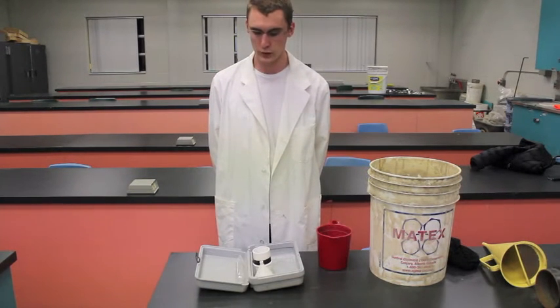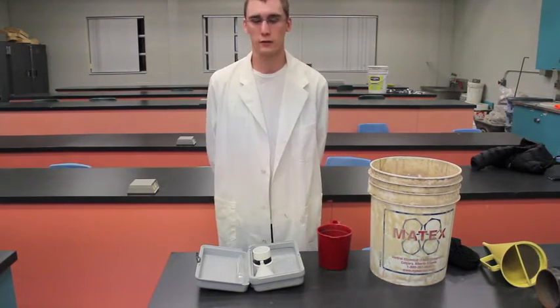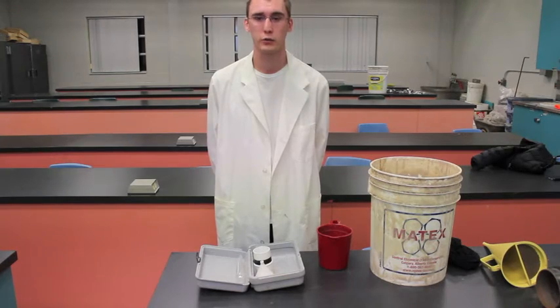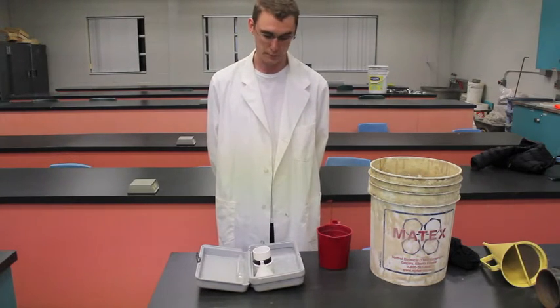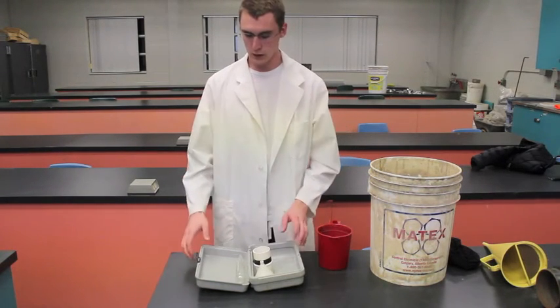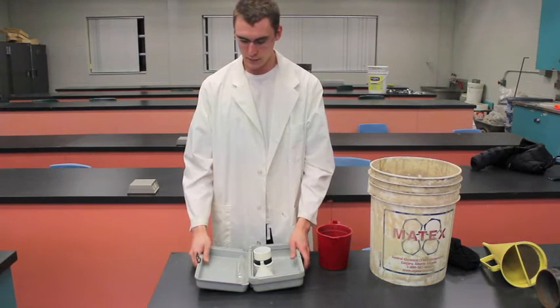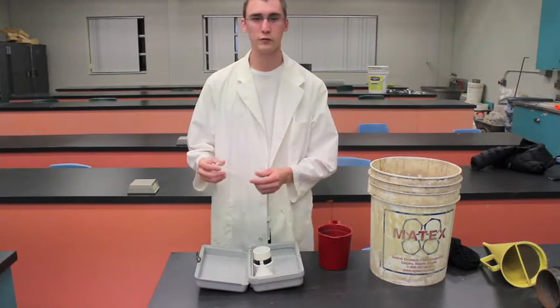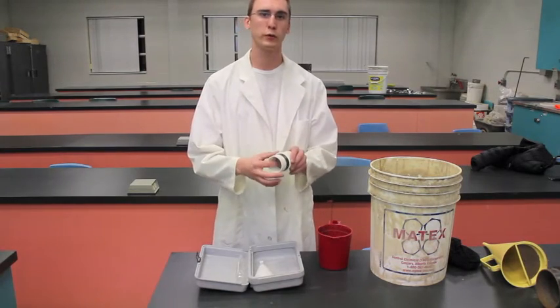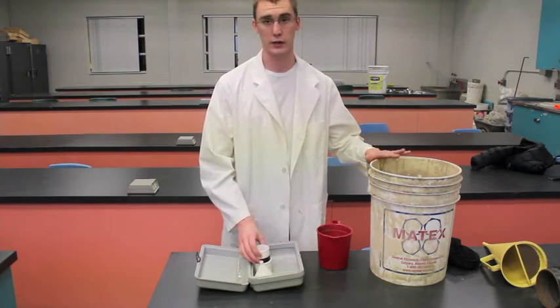So for our final test, we're going to be doing our sand content test. And this just measures solids of particles over a 200 mesh size screen. So, for this right here, we have our sand content measuring kit with our sand content tube, as well as our funnel with the screen in it, and then we have our mud right here.